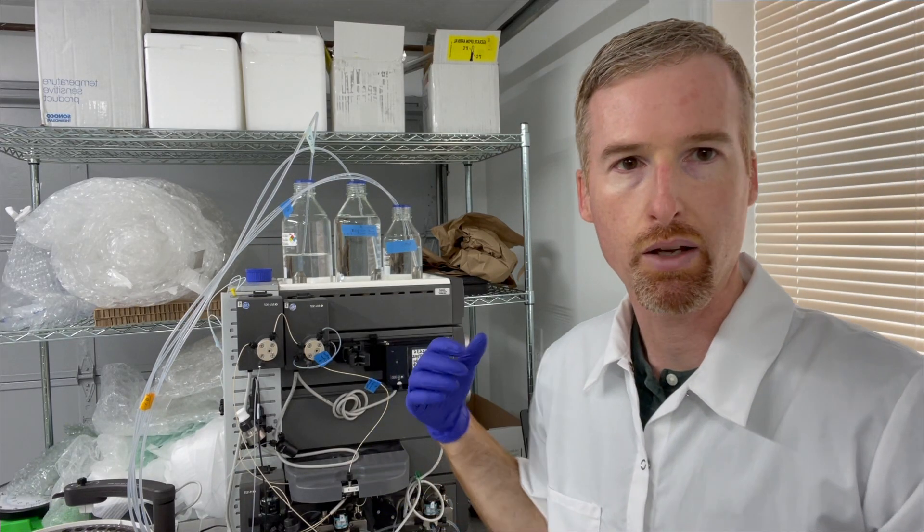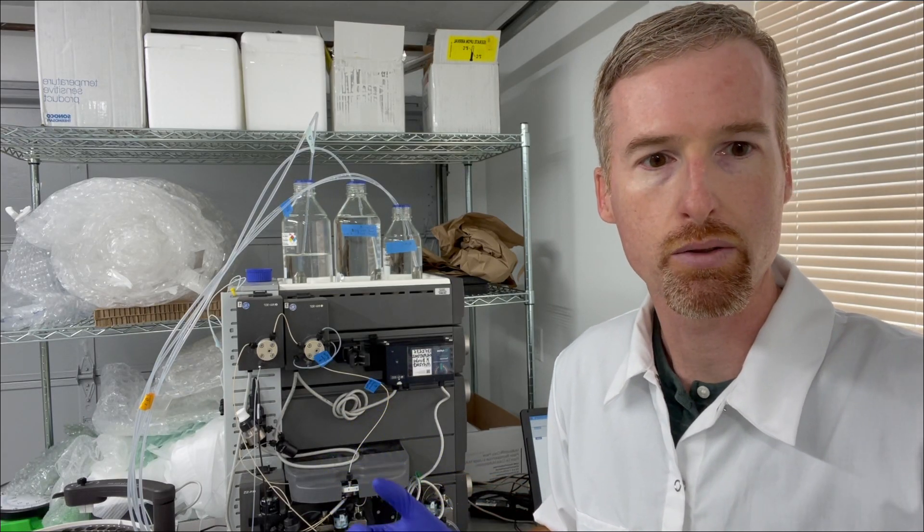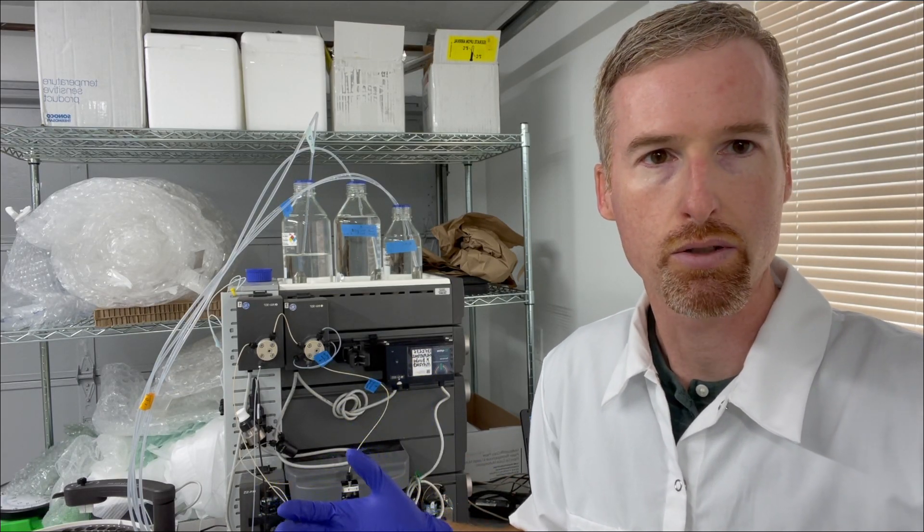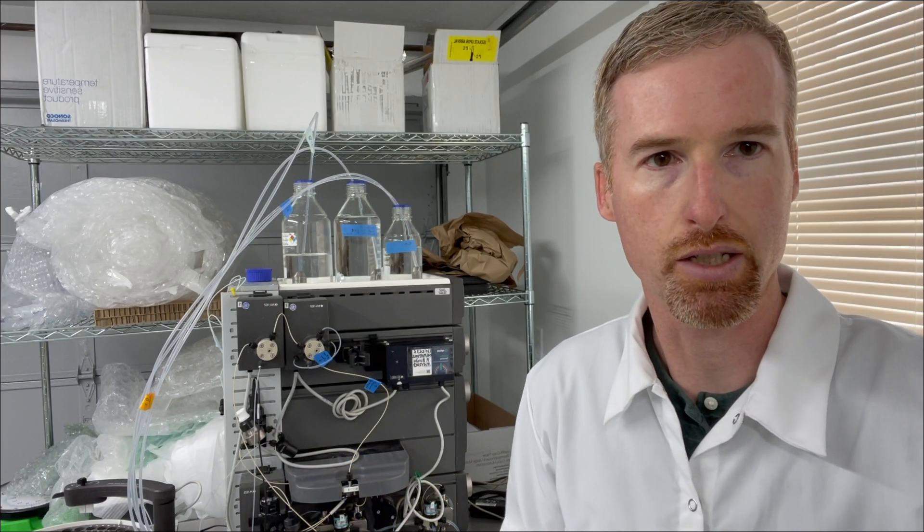Okay, so now the FPLC is ready and I'm going to see you over at the other table to load proteins onto the anion exchange column.